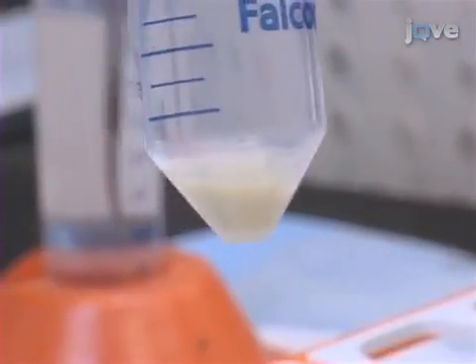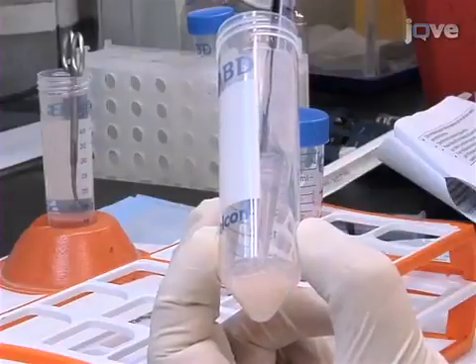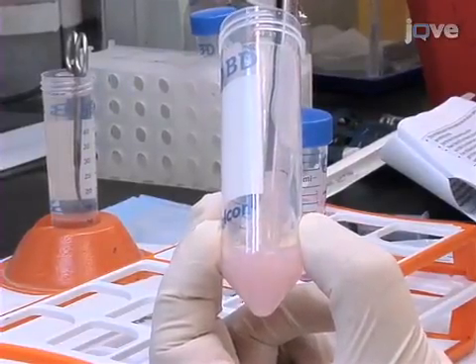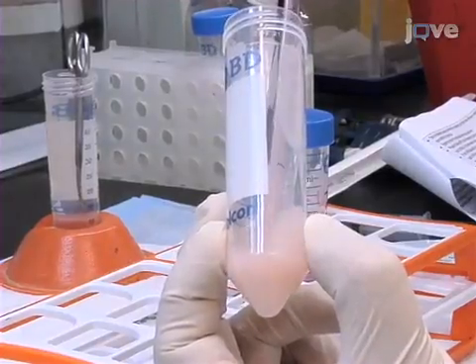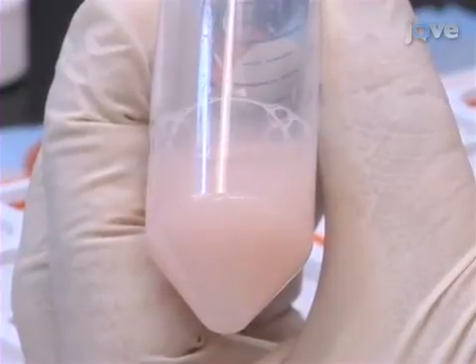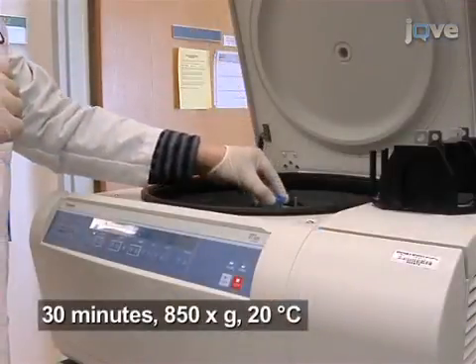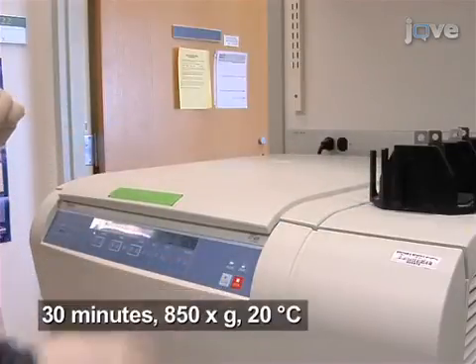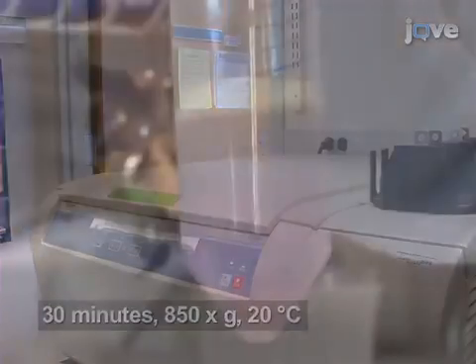After discarding the supernatant, resuspend the brain and spinal cord homogenates from 2 to 3 mice in 5 to 7 milliliters of 70% Percoll. Then overlay 7 milliliters of 40% Percoll and spin the Percoll and cell solution for 30 minutes at 850 times G, 20 degrees Celsius, with no brake.